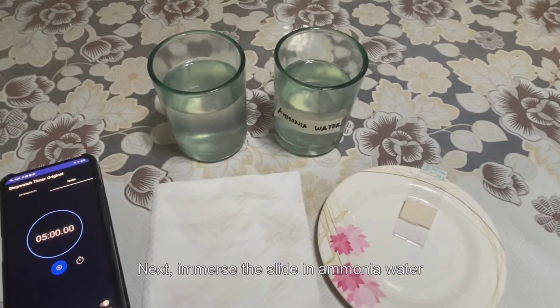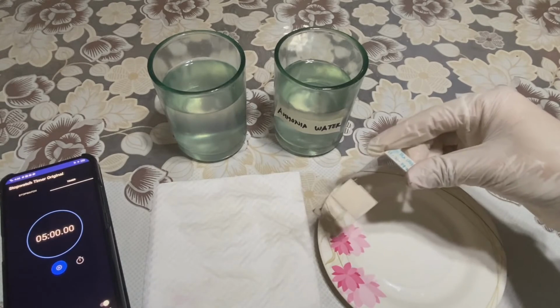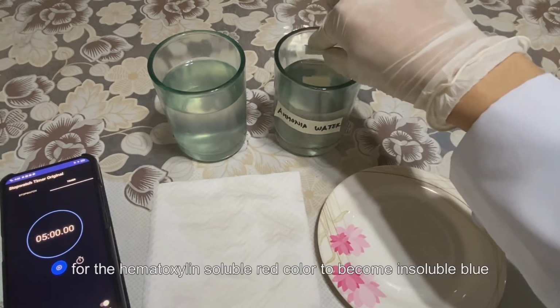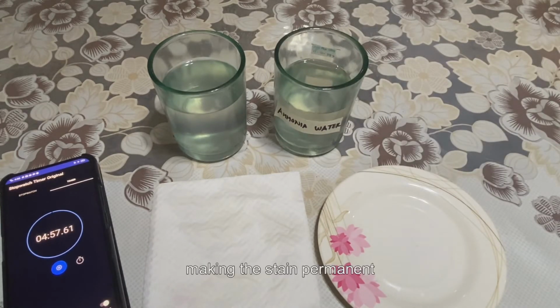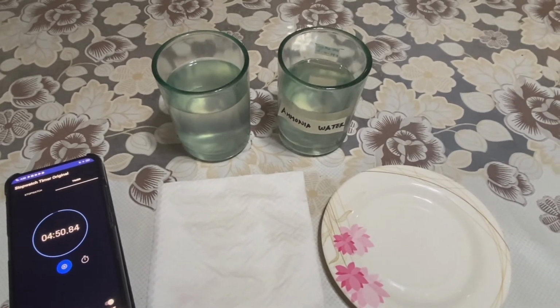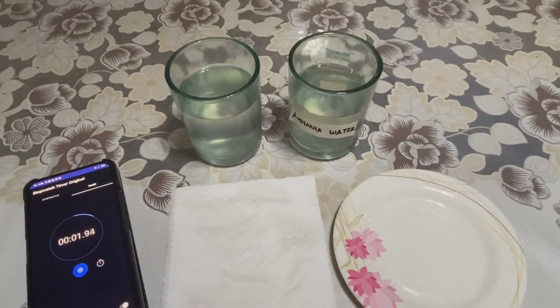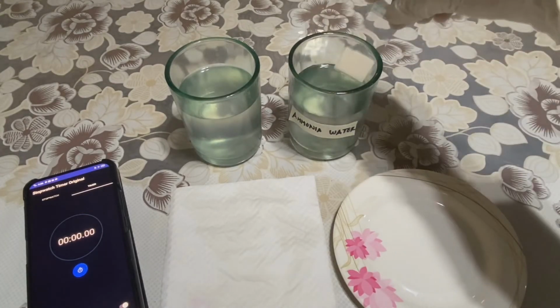Next, immerse the slide in ammonia water for an average of 5 minutes for bluing. Ammonia will provide an alkaline environment for the hematoxylin-soluble red color to become insoluble blue, making the stain permanent. Rinse with water and drain excess water with paper towels.